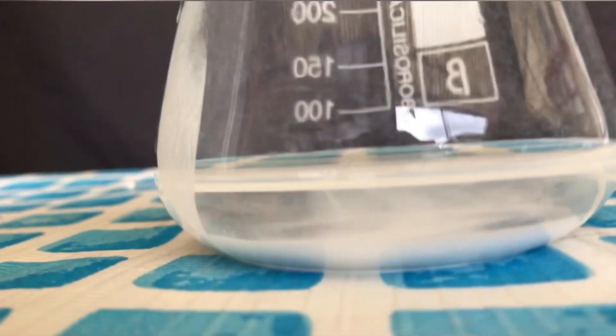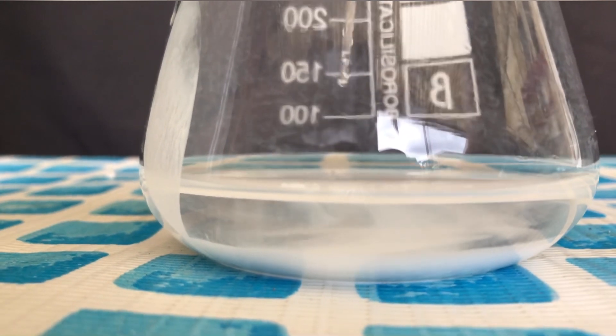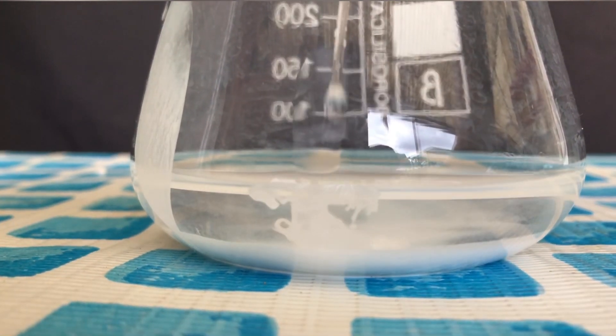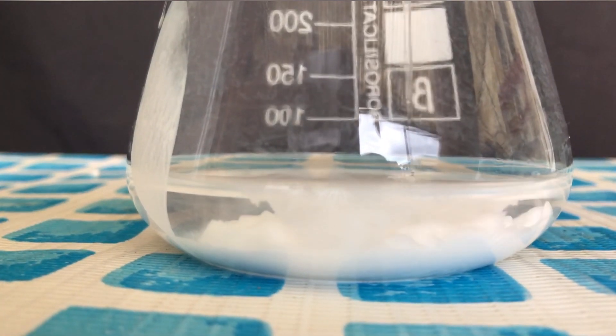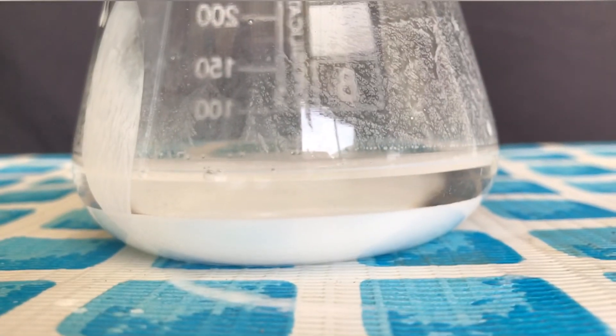Because we didn't know how much sulfuric acid we had added yet and how much we still needed to add, we added some more. As long as there is barium sulfate crashing out of solution, we are not finished and we need to continue adding more acid.